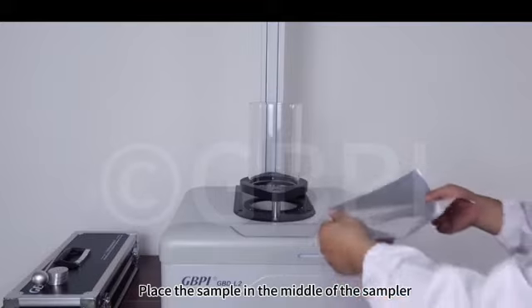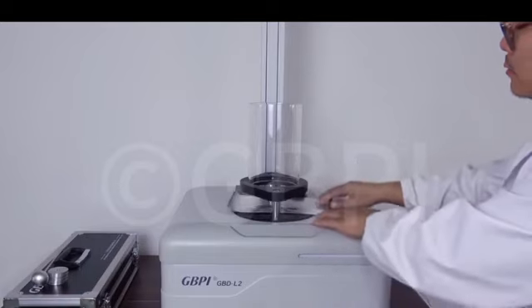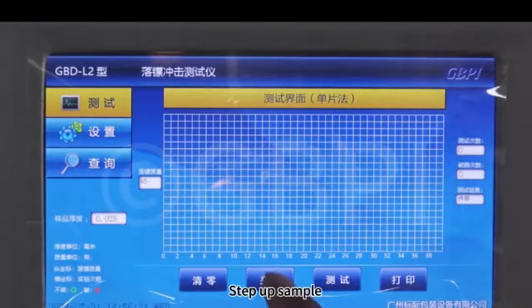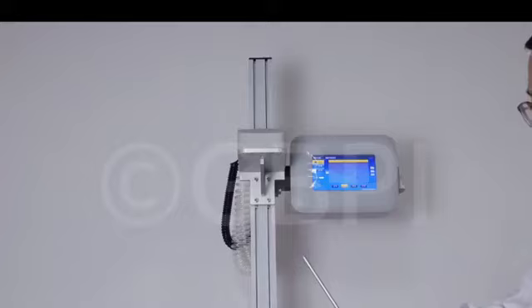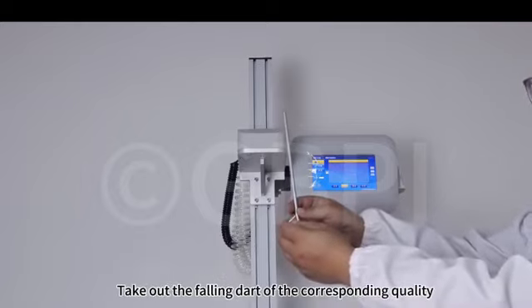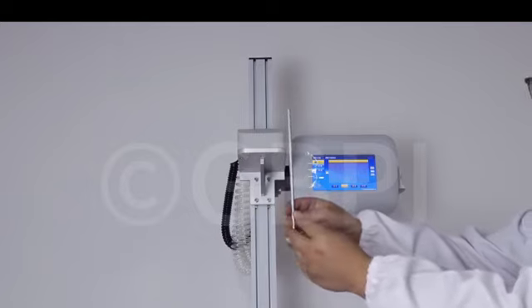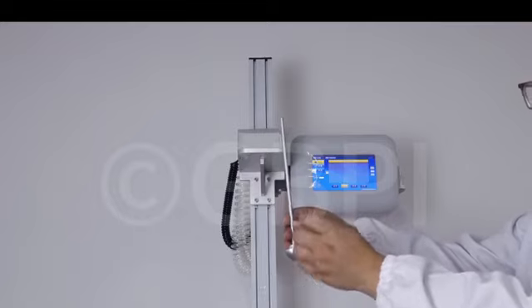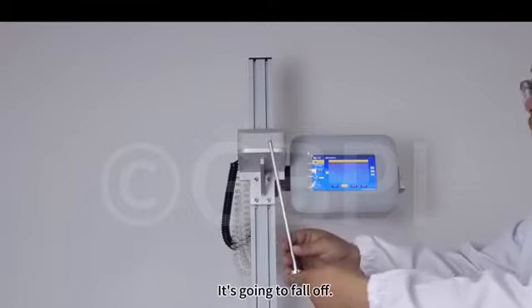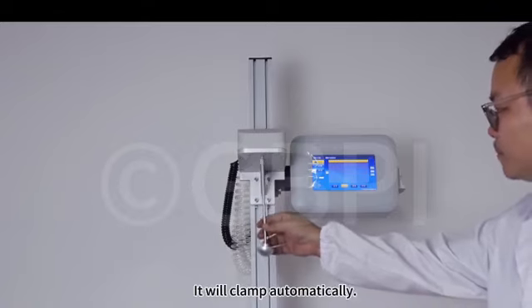Place the sample in the middle of the sampler. Click Add Sample again. Set up the sample. The mass of the falling dart is filled in according to the display. Take out the falling dart of the corresponding quality. Then lock. Why tighten it? Because during the fall, if this ring is not tight, it's going to fall off. Then put it in the hole. It will clamp automatically.